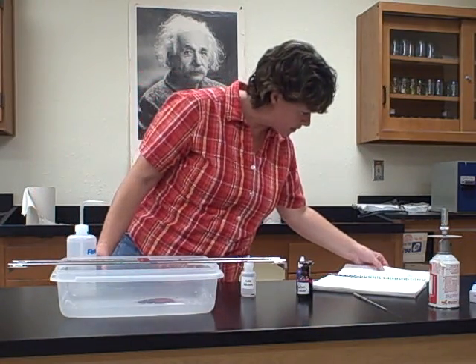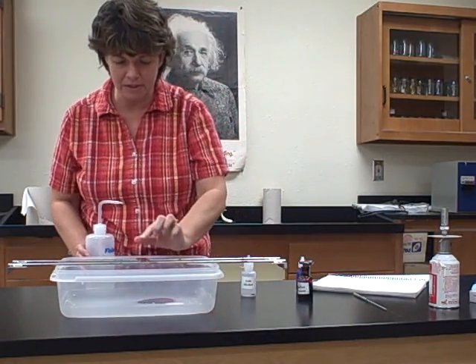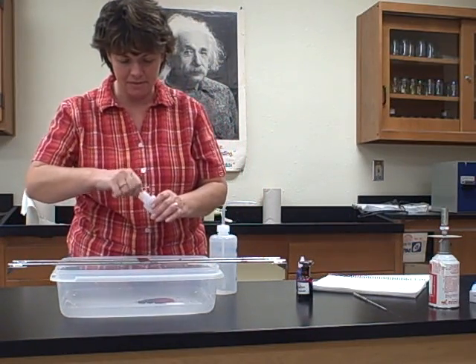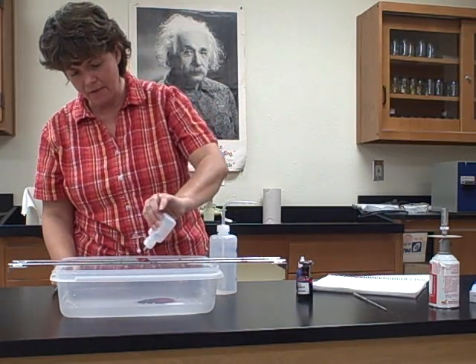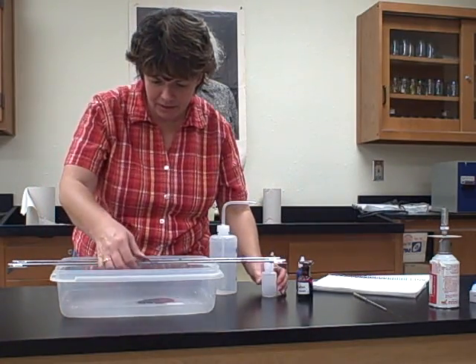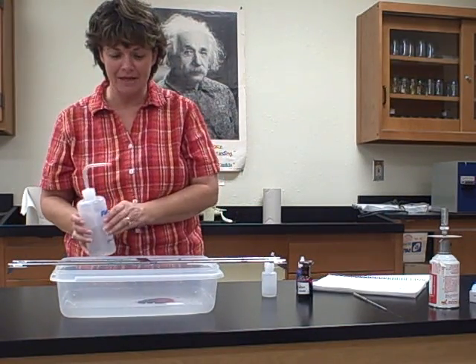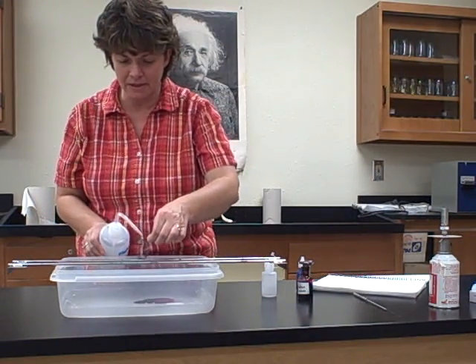So let me go back. I'm sorry I got ahead of myself there. So I rinsed with my water, okay? So I did the carbol fuchsin, rinsing with my water. Now I'm going to decolorize with acid alcohol for a minute, okay? And I don't have much in here, but here's the acid alcohol. So I'm going to put it on there, and instead of washing it off immediately, like I did with the ethanol for the gram stain, I'm going to let it go for a minute, okay? So our minute has passed, and then I'm going to rinse it off.